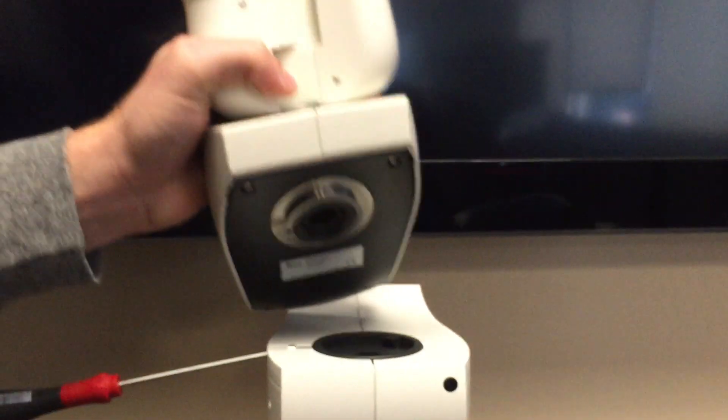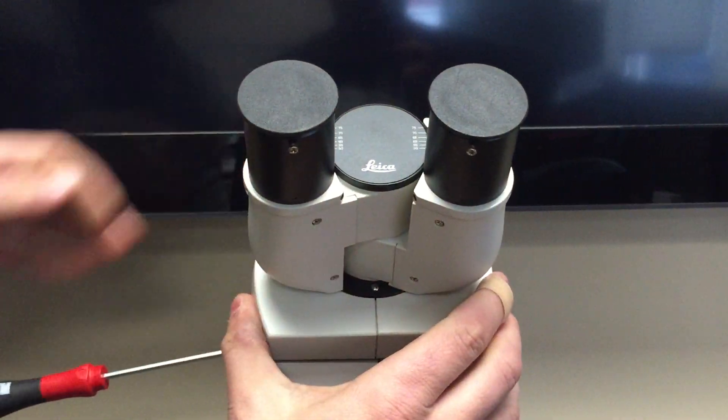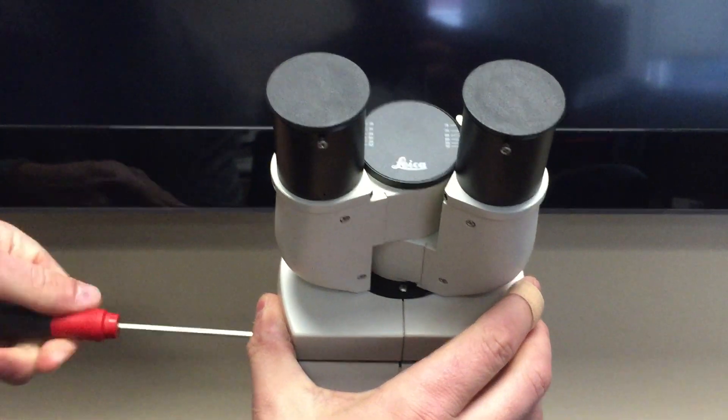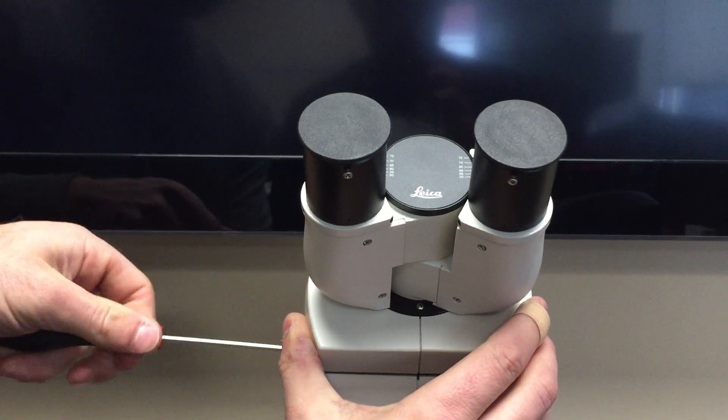Install the viewing head, holding it in place to make sure it doesn't fall off the microscope, and center it as well.